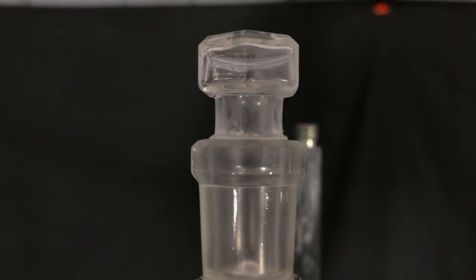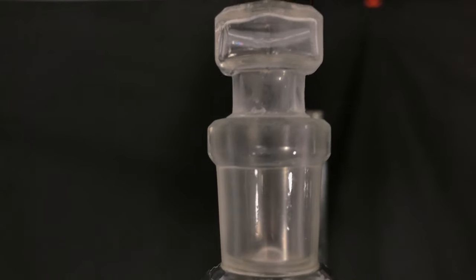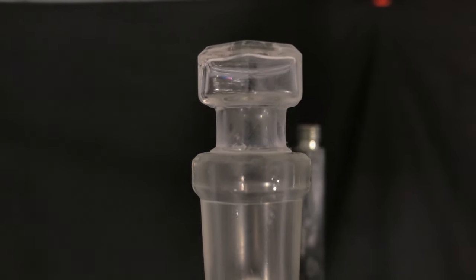When in contact with water, like moisture from the air, boric acid and methanol are again formed. This can be seen on our glass stopper and also inside of the tube leading outside.